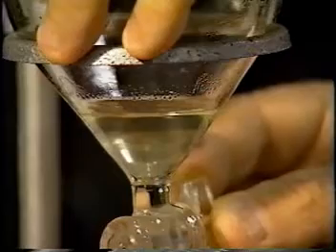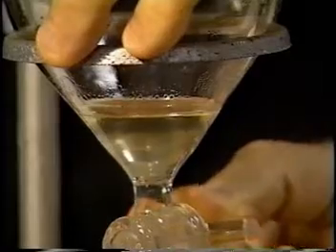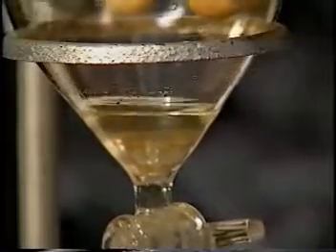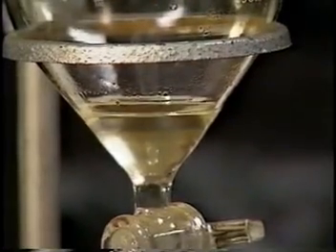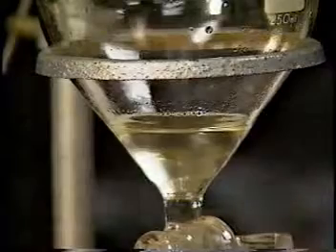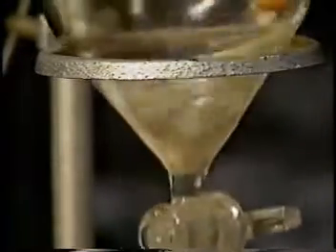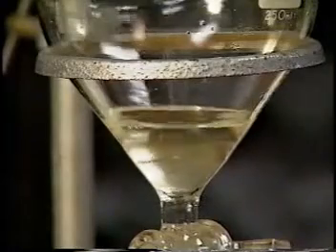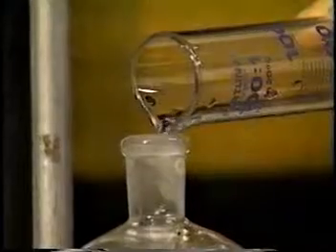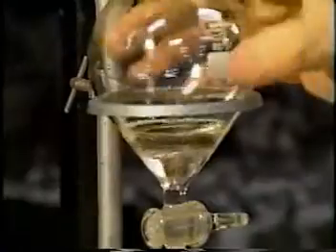We watch the interface between the two liquids and stop when the aqueous layer has been drained off. What we're left with is the separated organic layer. Now we slowly add 10 milliliters of sodium carbonate solution and shake gently. This dissolves any sulfuric acid or ethanoic acid left in the ester layer and takes any sulfate or ethanoate ions into an aqueous layer.